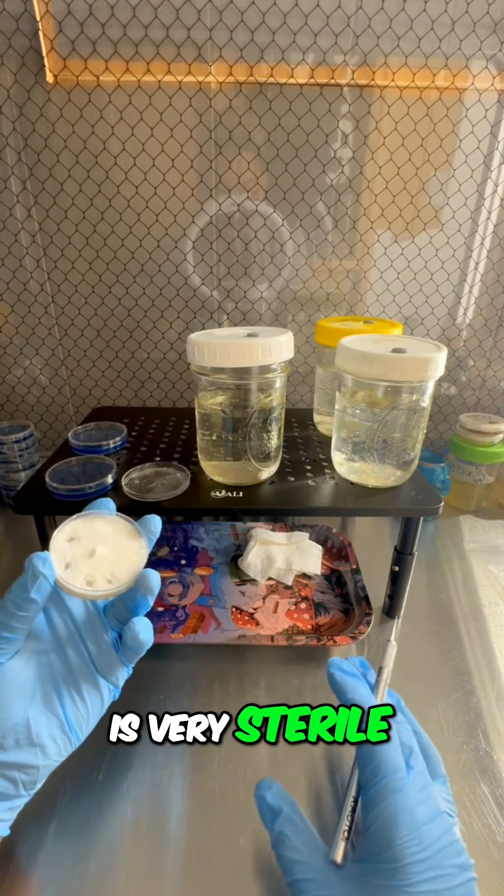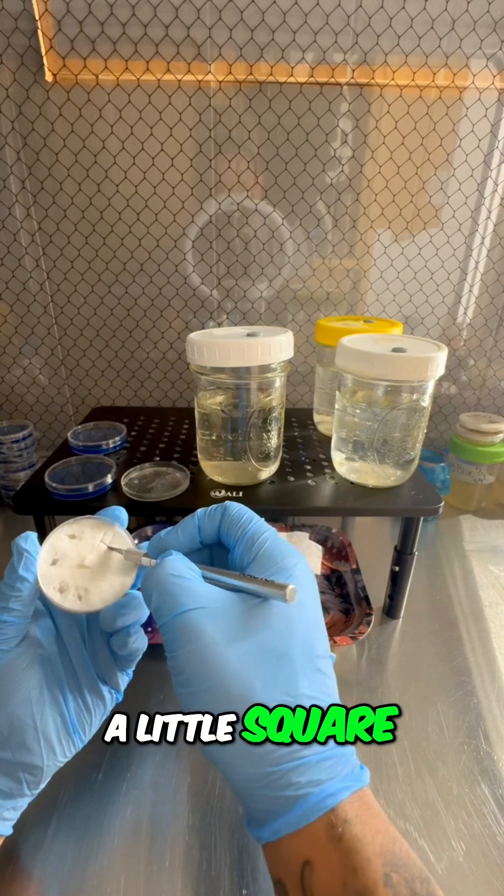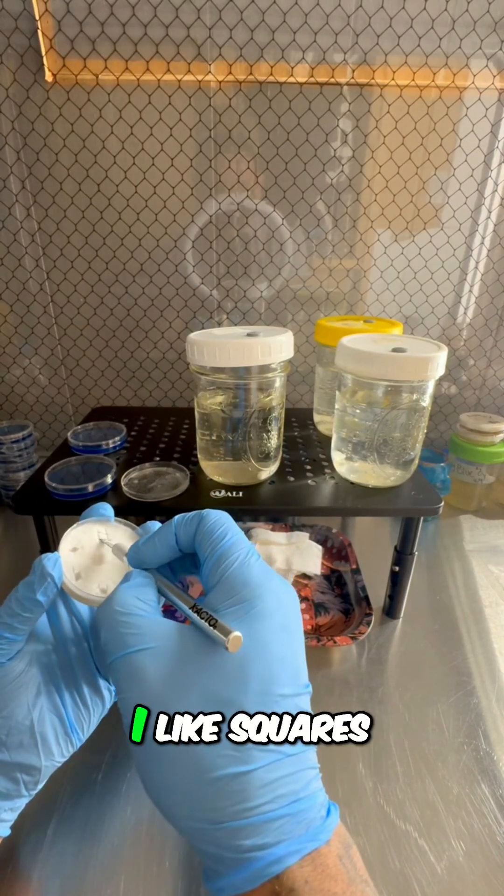Make sure this environment is very sterile. All you need is a little square - you can make it a triangle, whatever shape you like. I like squares.